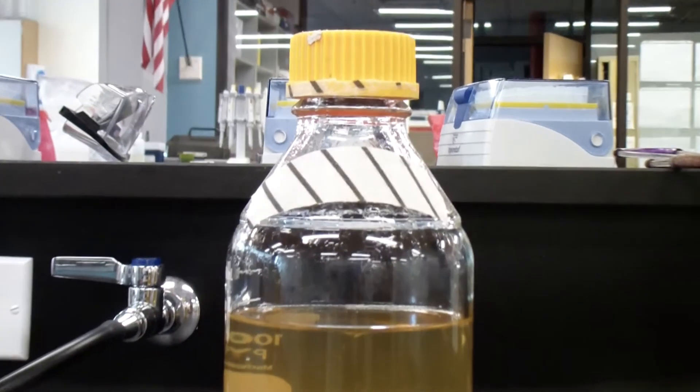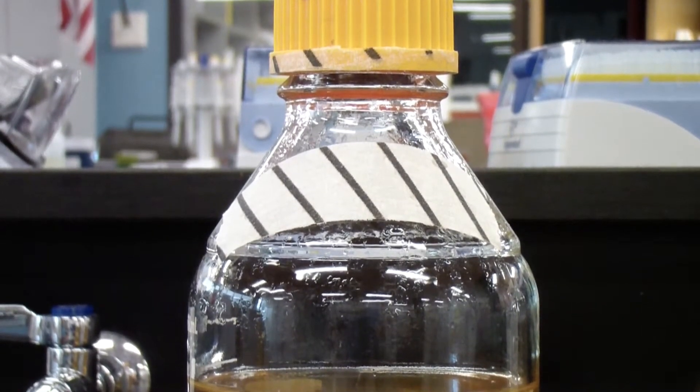We use special autoclave tape, the stripes of which turn dark if the cycle was successfully completed.